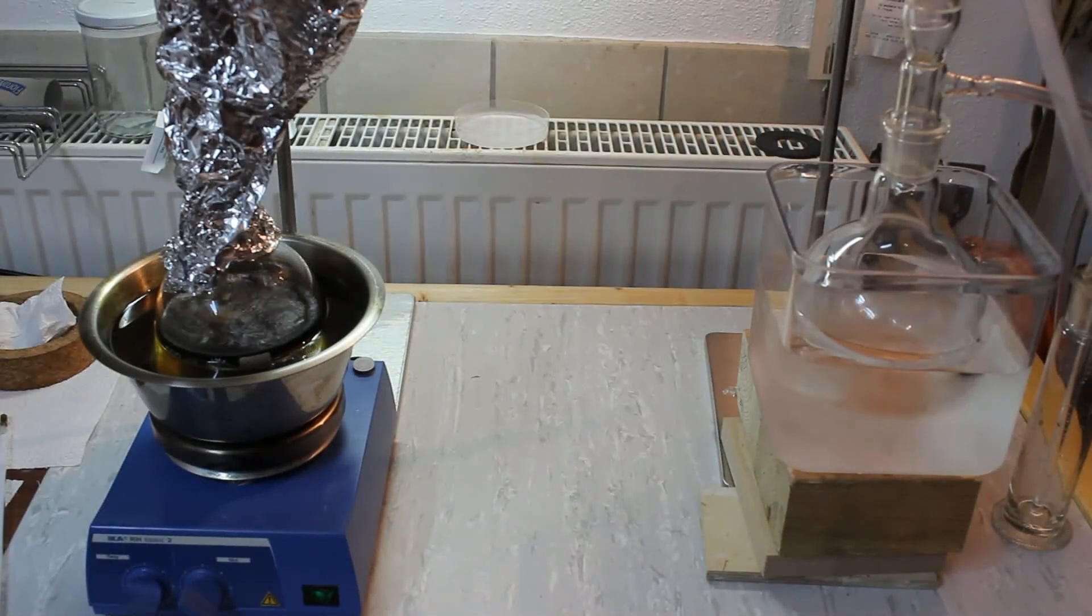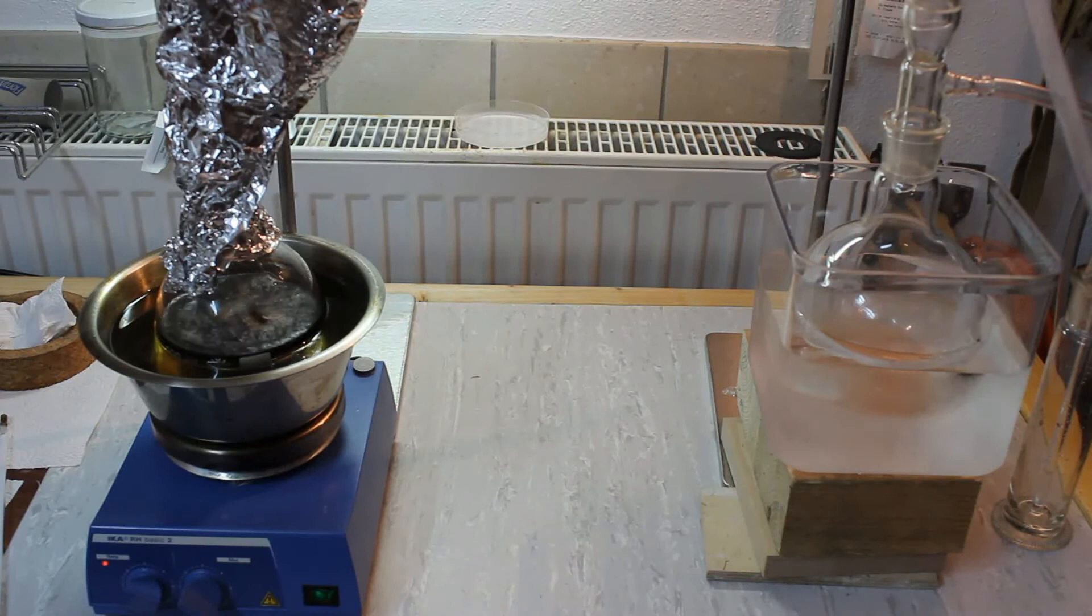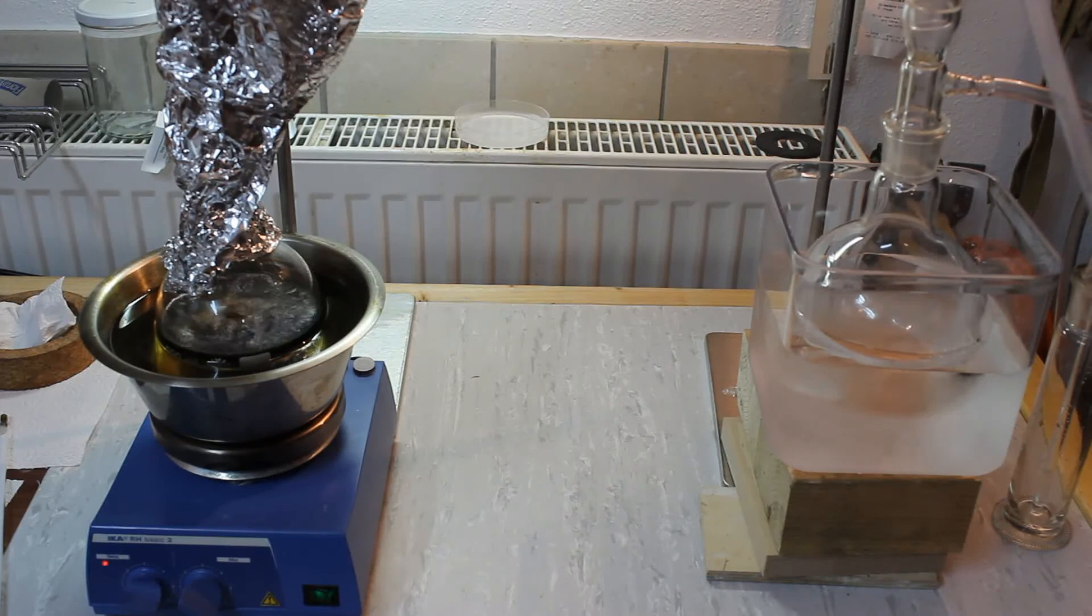The stillhead temperature is now stable at 60 degrees Celsius which indicates that we are distilling over a mixture of ether, ethanol and water. Which of course is to be expected since we are carrying out a condensation reaction.